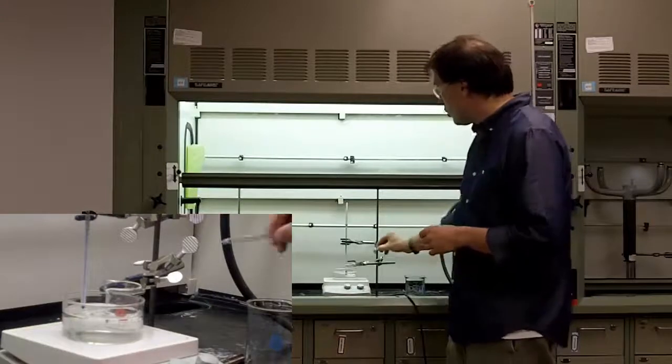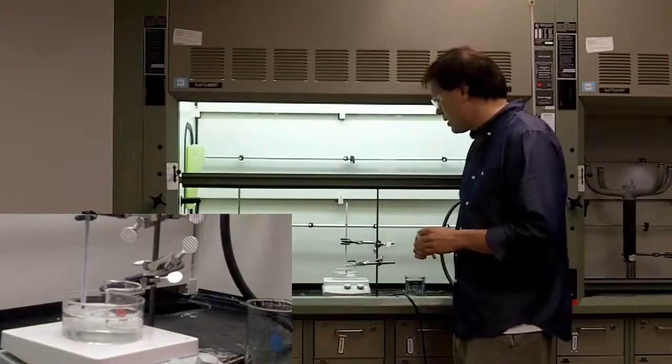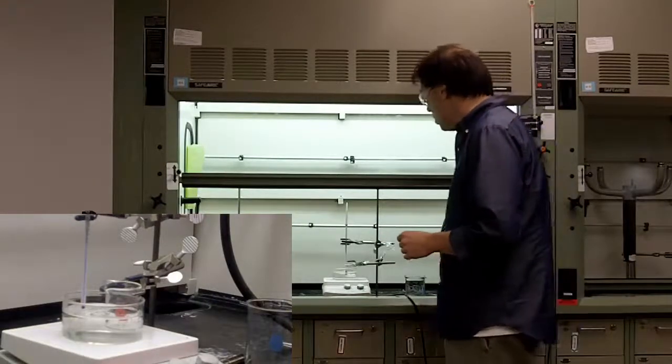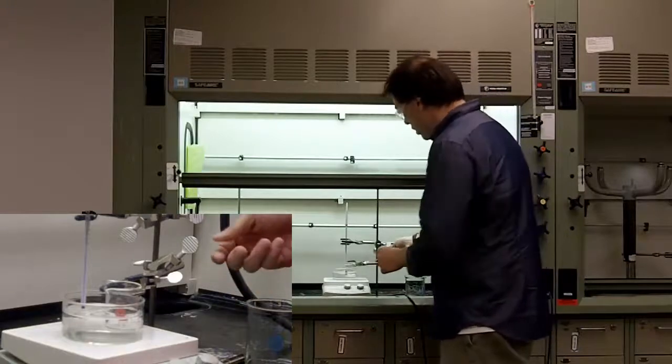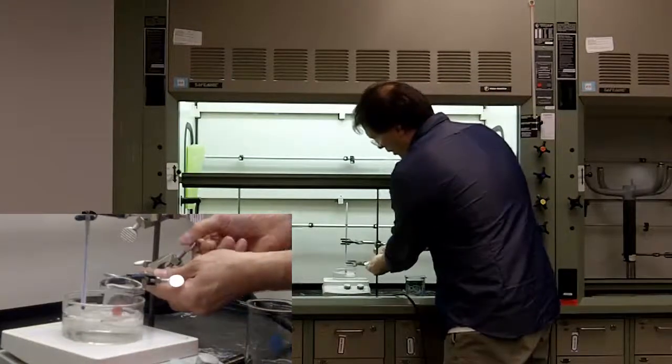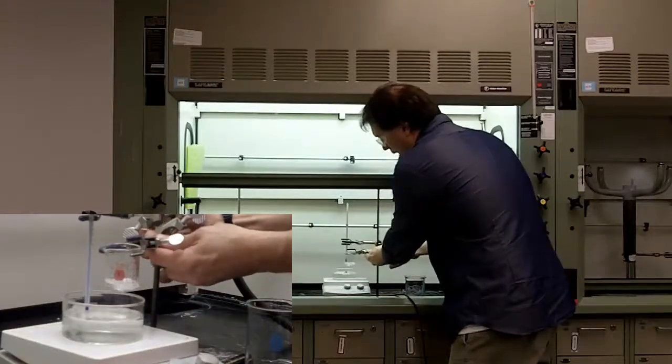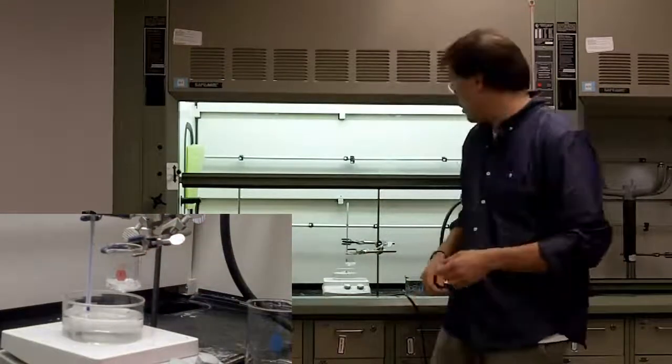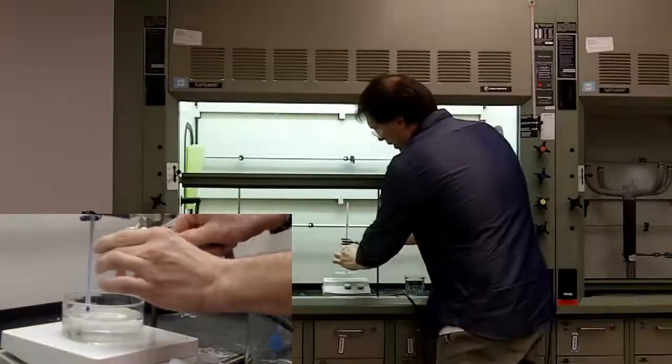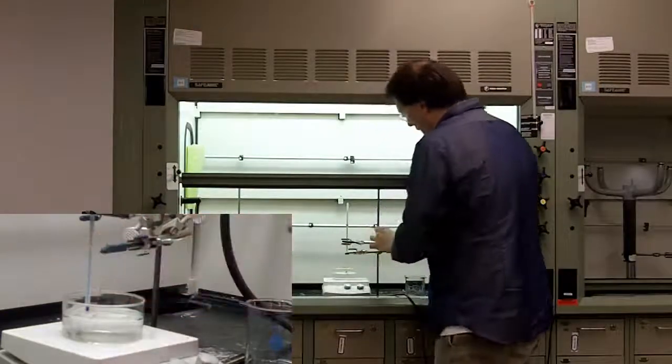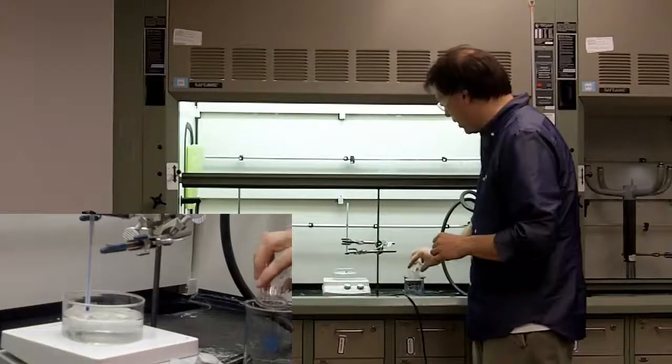Well, eventually, you're going to run out of room in this beaker. So, what you can do is take the beaker out of the water by raising it up, letting it cool for a minute so that you don't burn yourself, then transfer that material into a larger beaker.